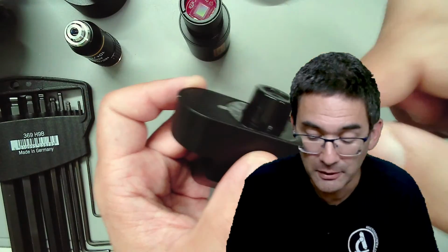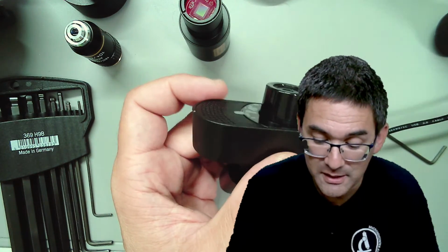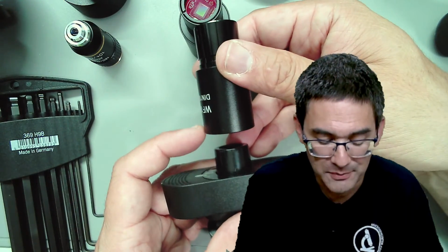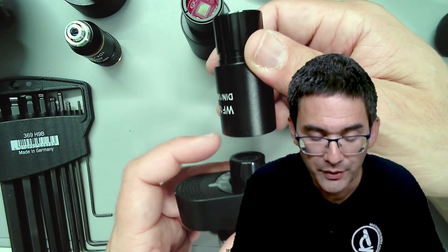Maybe you can construct some kind of an adapter yourself, where you can switch the camera. People have been doing that, some tube that goes over the eyepiece. Or you buy yourself a separate eyepiece and wrap some cardboard around it, a couple of layers, with a little bit of hot glue.